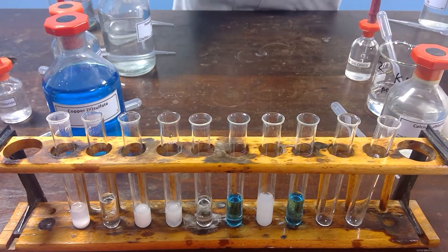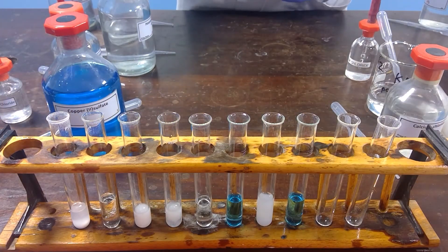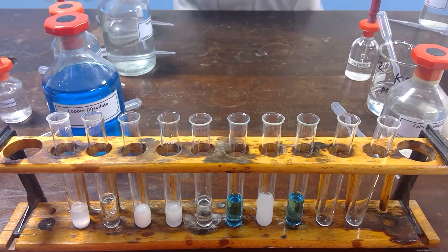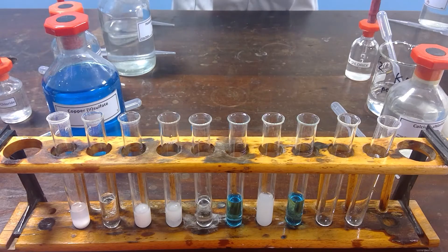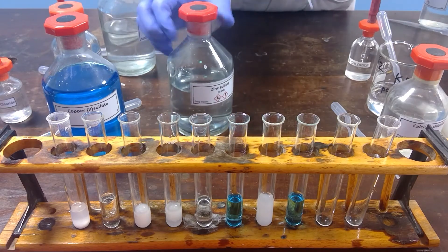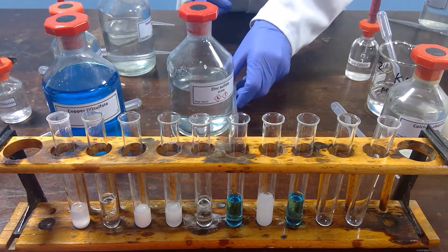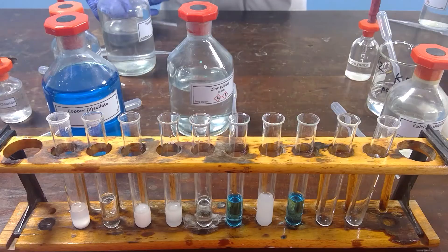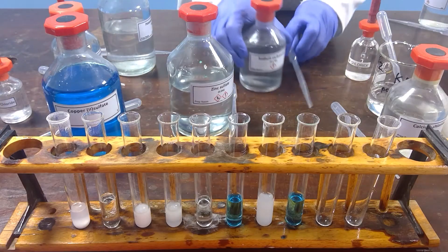In number 9, we have zinc sulphate combined with sodium carbonate.